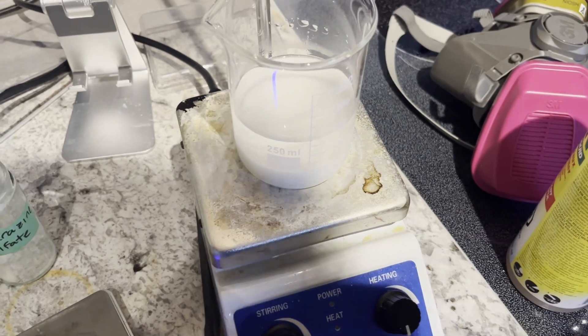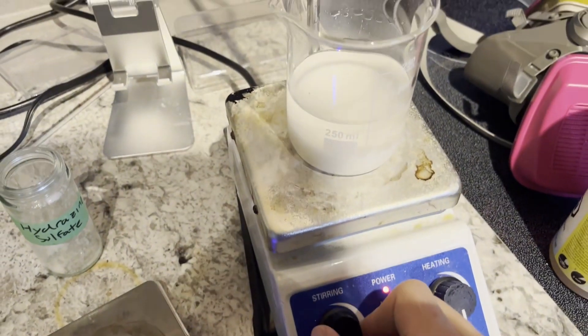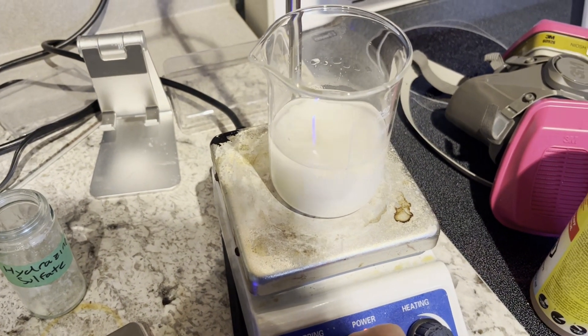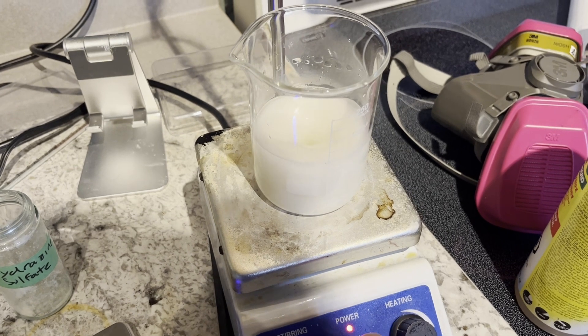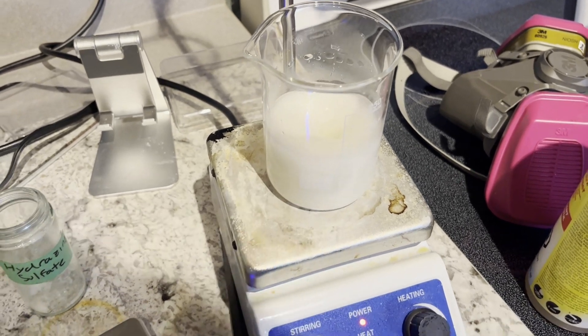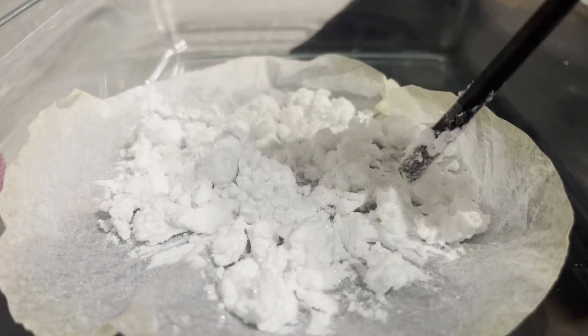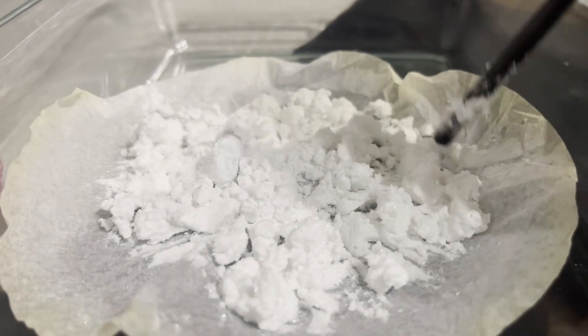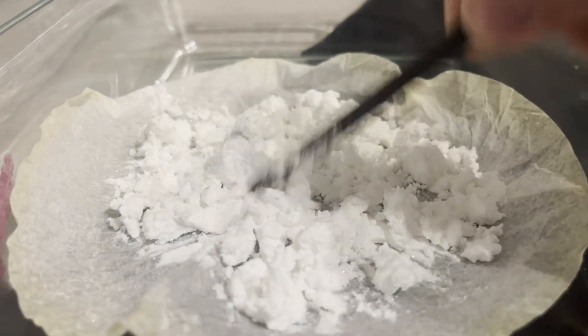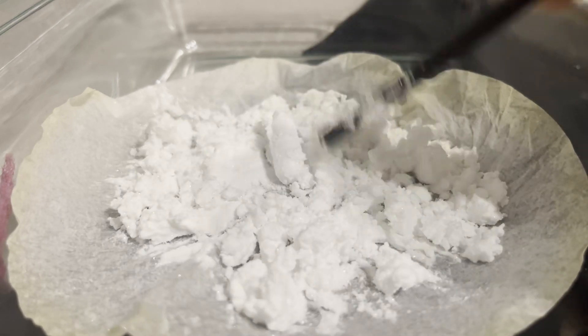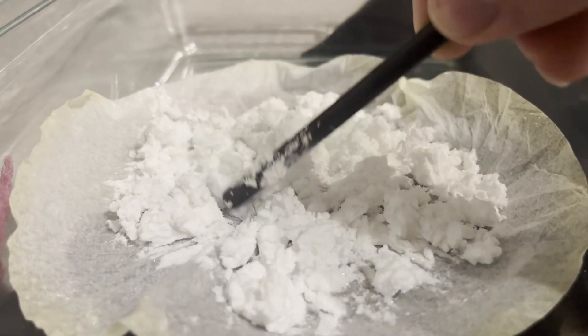I let it stir for a couple hours, then came back to it, filtered it again, and laid it out to dry. Here's what it looked like after two days drying. I'm not going to wait anymore because I'm not going to measure this yield. The reason for that is because I added some old stuff into it.